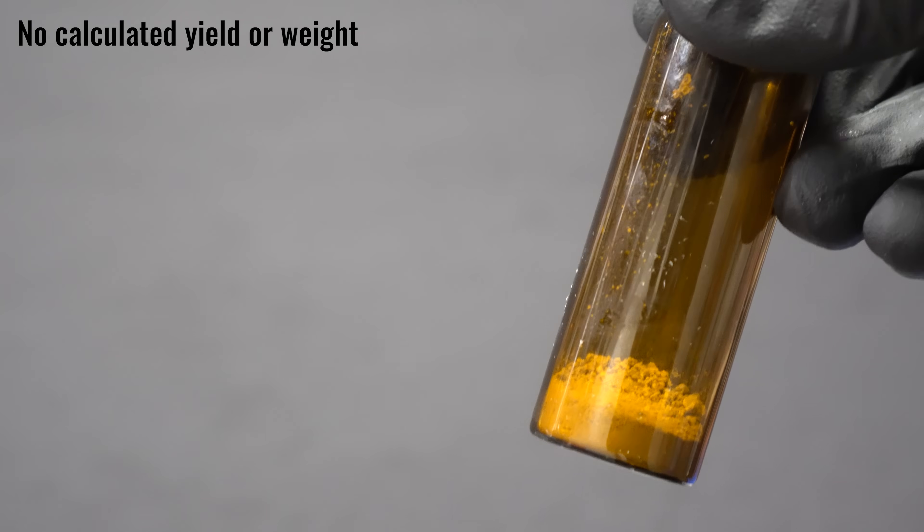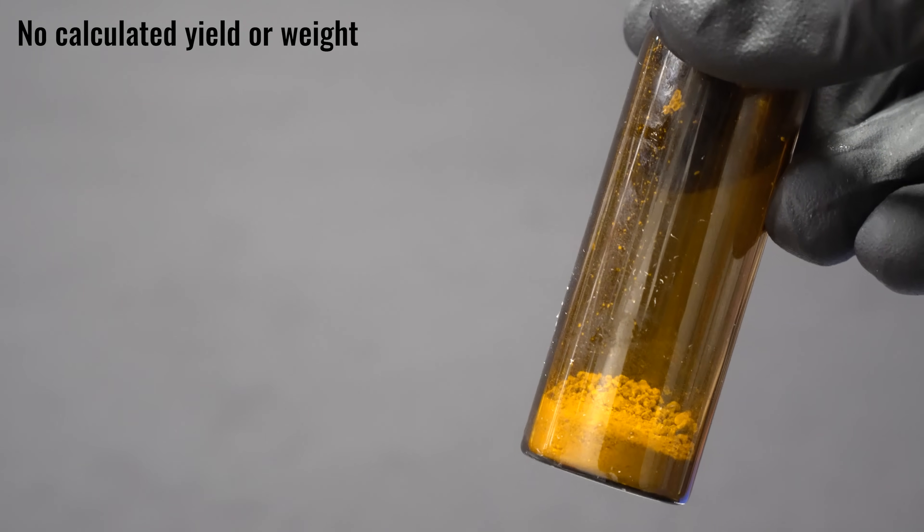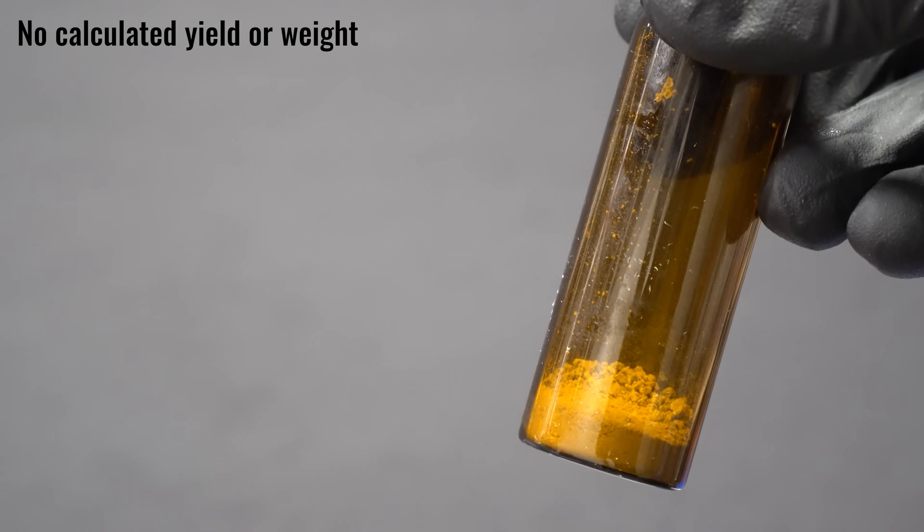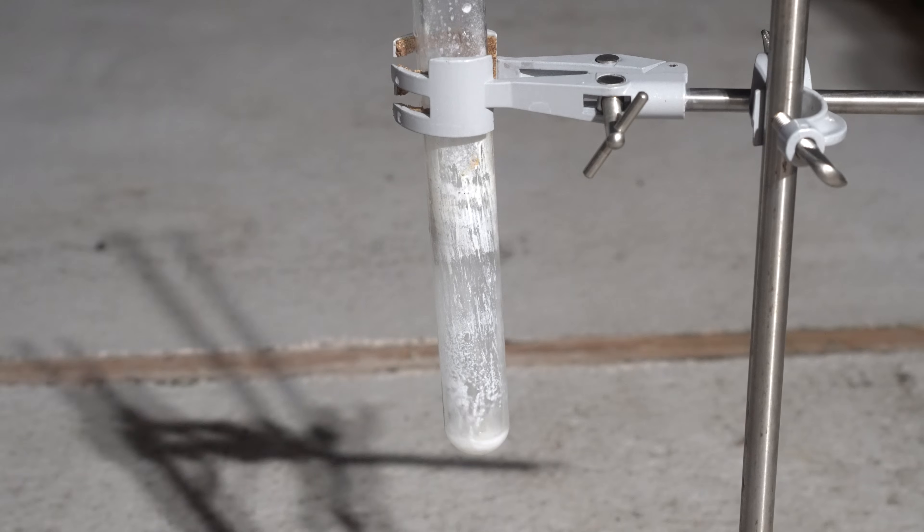I didn't calculate weight or yield, as I just wanted to see if this worked. Please don't shun me as a chemist. Cleanup is actually insanely easy, and I just throw some water in there. You can see it immediately dissolve, and the sodium metal will also react with water, and make it easy to clean up.